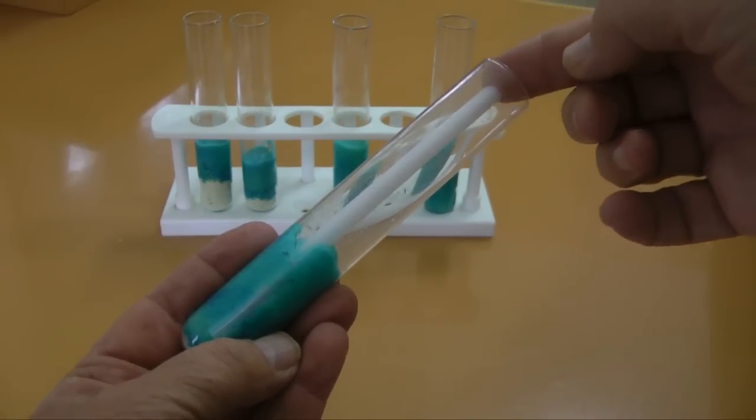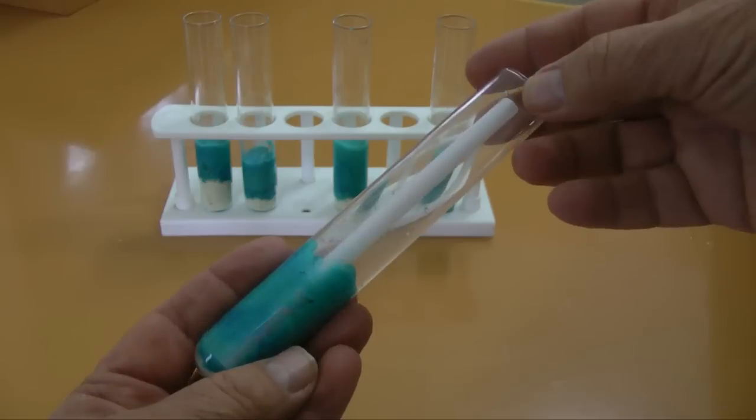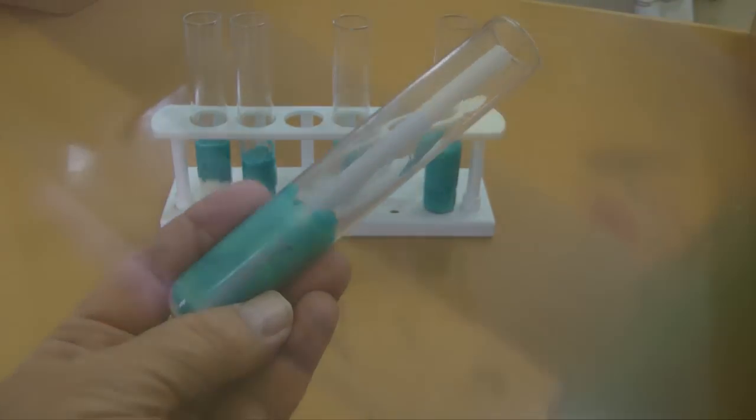Here's one way of accomplishing that. When preparing new Drosophila colonies, I placed a plastic straw in each tube. About a week after starting the colonies, larvae climb the straws and pupate.